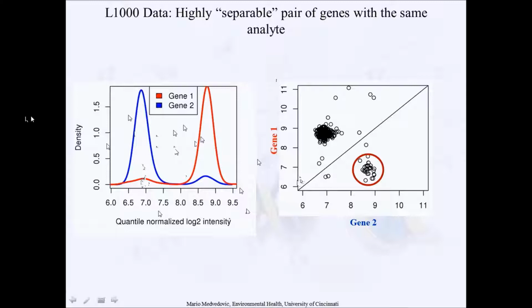The problem with this particular kind of error is that they are really big, right? So if you look at this, a change of 7 to 8.5, so this is a 1.5 fold change. So this is a significant change over the typical distribution, say, of gene 2, and this can introduce a lot of spurious correlations. I guess that's the idea, if you're not careful.